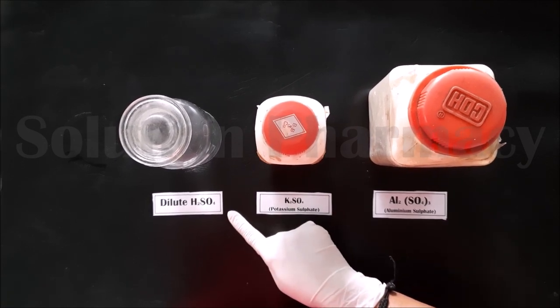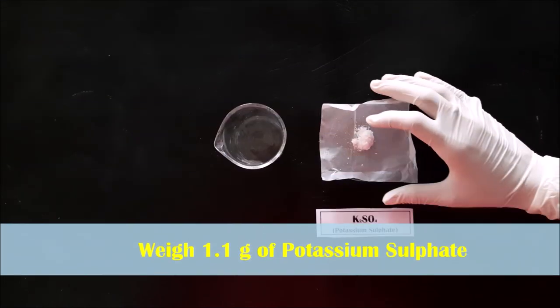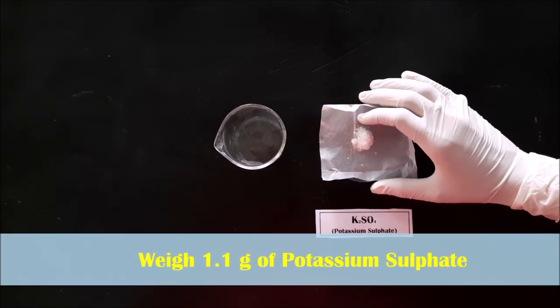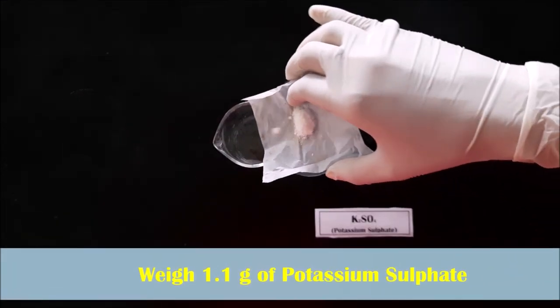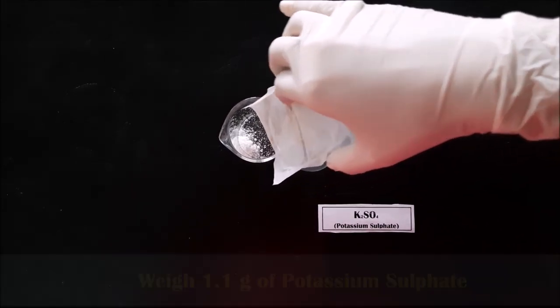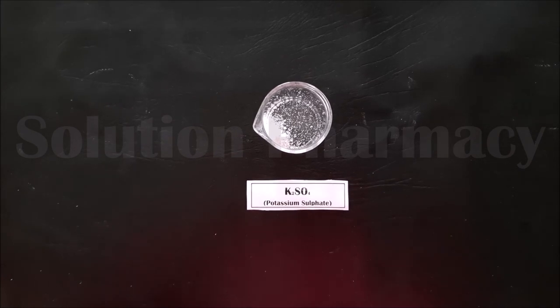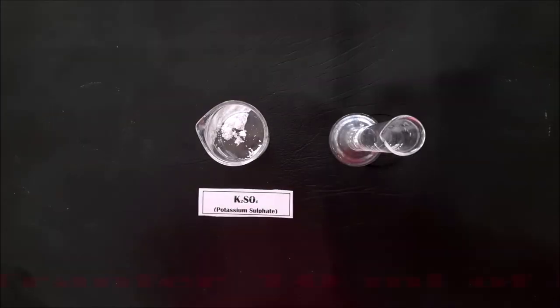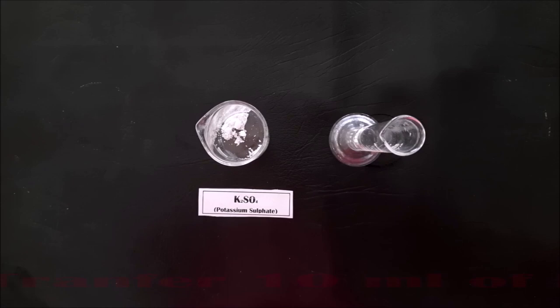The third ingredient is dilute H₂SO₄, and distilled water is also required to make the solution. First, we have weighed 1.1 grams of potassium sulfate and transferred it into a clean and dry beaker. Then we measured 10 ml of distilled water in a measuring cylinder.